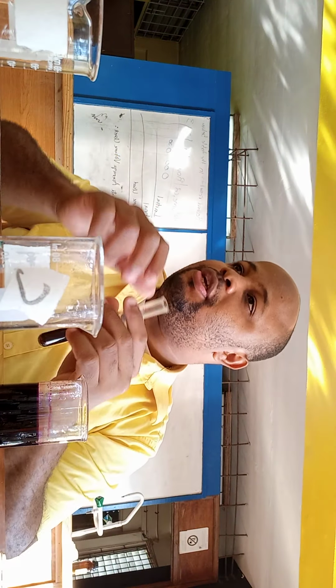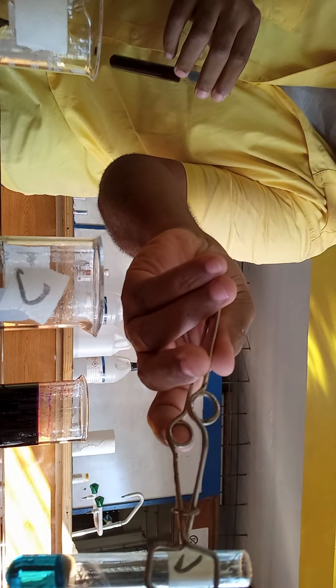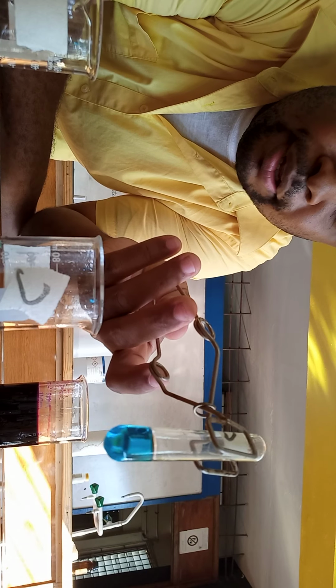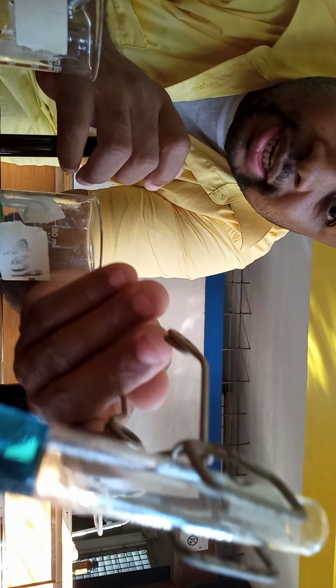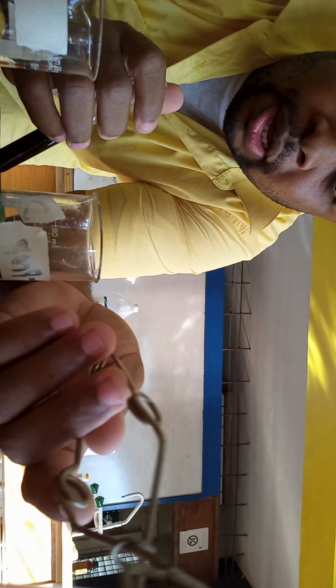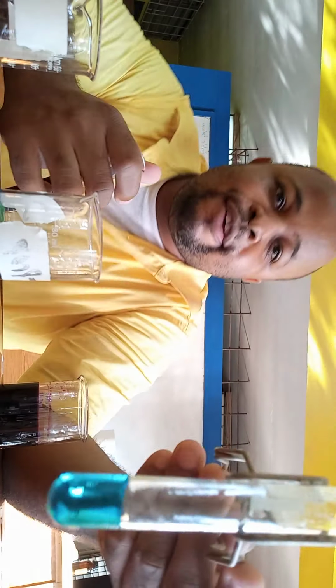Also, I had done as well, I had put the two of them in the Benedict's solution. So you know, if it was an aldehyde, it would have given a color change. And okay, where's the test tube holder? This is test tube C. As you can see, it is still blue. And test tube C was the primary alcohol, which means it is not an aldehyde, it's a carboxylic acid, because the copper 2 ions, which are present in both Fehling's solution and Benedict's solution, would have been reduced to copper 1, which is why you would get the red color. So we can see that C is not an aldehyde, it has gone to the carboxylic acid.